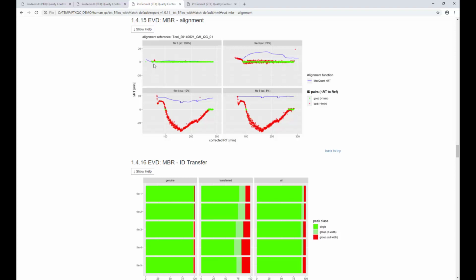So ideally, you want to see all those dots, which each represent one peptide, on a single line here, right? They should all be green. They're colored green if they're within a delta RT of 1 minute in this case, because that's what the MQPAR file tells us about how the matching was done. So if you're within 1 minute, you're green, and you get a score, in this case, of 100%, because give or take 100% of all these peptides are aligned perfectly to our reference.